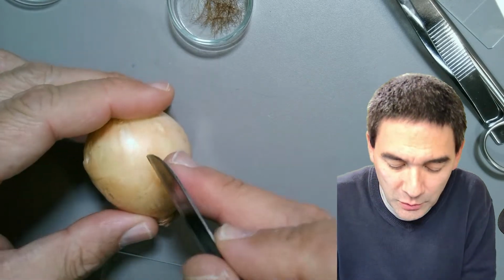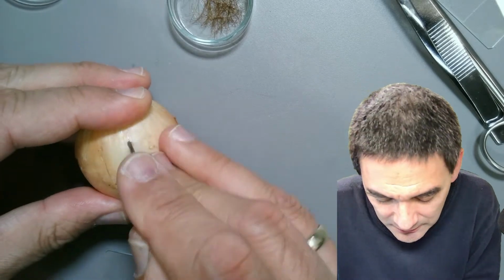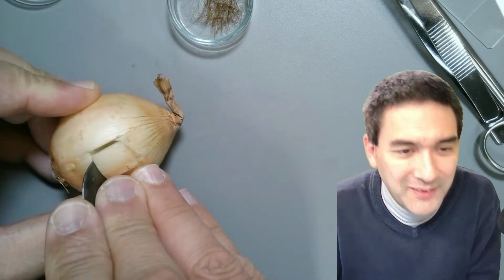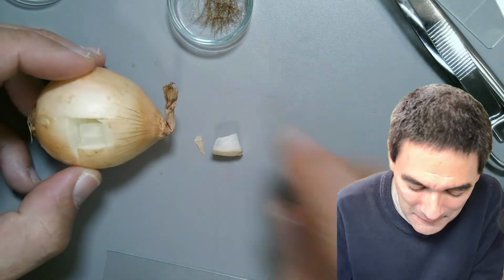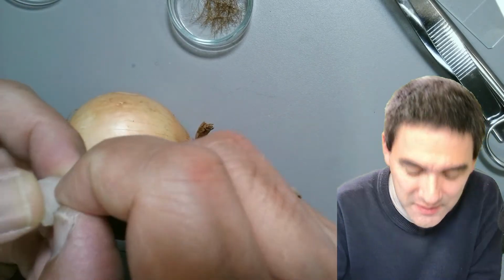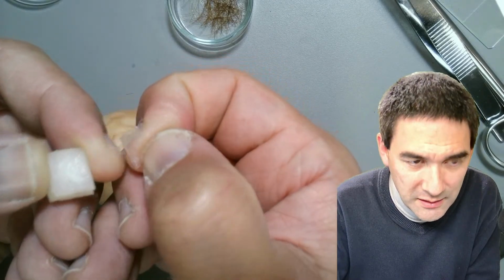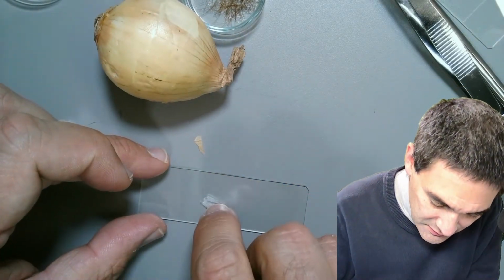I'm going to simply make this the standard onion slide, like many of you probably already know how to do, and if not, then it's also good that you're able to see what I'm doing right now. And let's hope that we're able to find this thing here. Look, this. Did I get it? Yeah, here it is. Okay, do you see this onion skin? Let's put it over here on the slide.